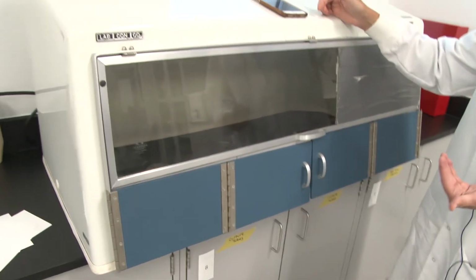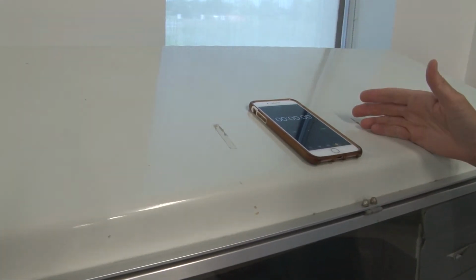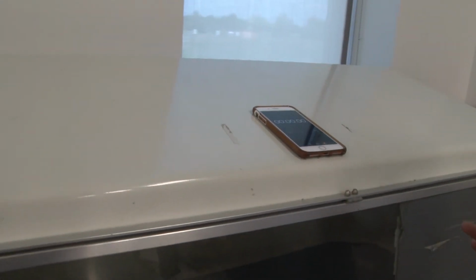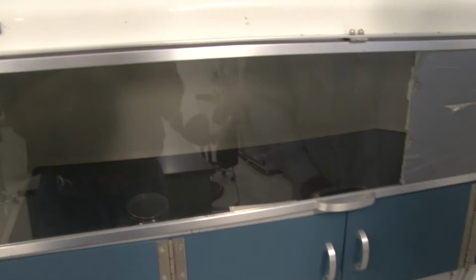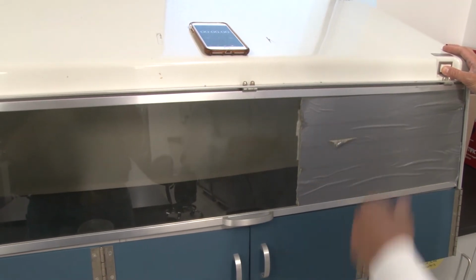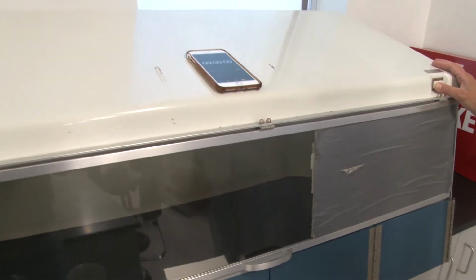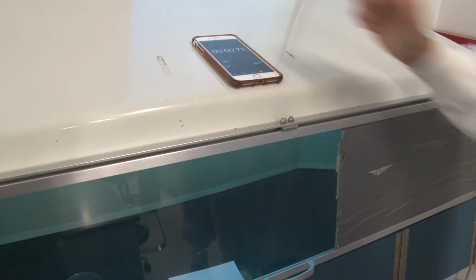And here I have my cell phone. I am going to watch that for 10 seconds. I'm sorry, for 30 seconds. We're going to let it go for 30 seconds. I'm going to flip this on and start when the light turns purple, and you see it turn purple. I'm going to start the watch. We're going to go 30 seconds, not 60, and you'll see why in a moment. So here we go. When the light comes on, we hit start.